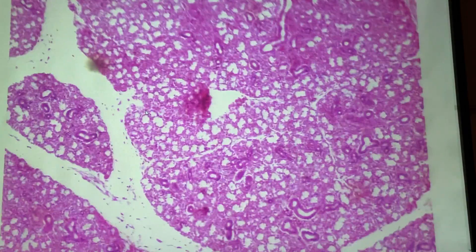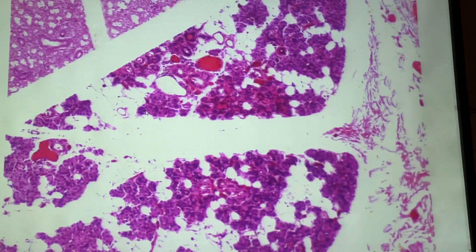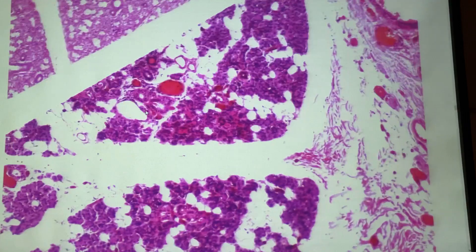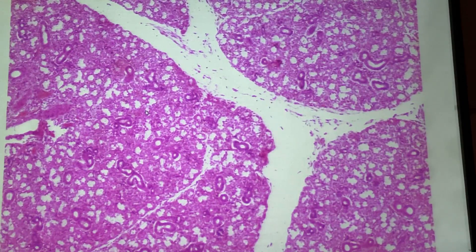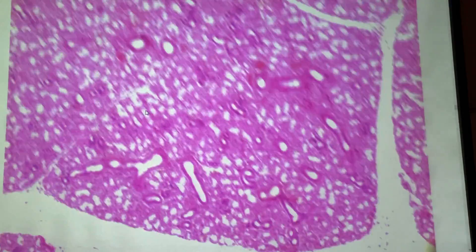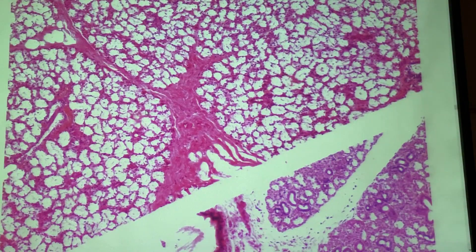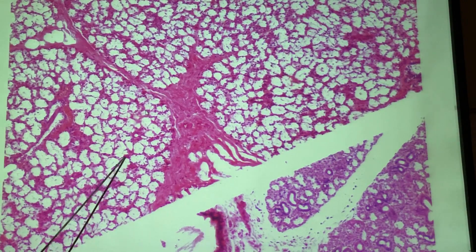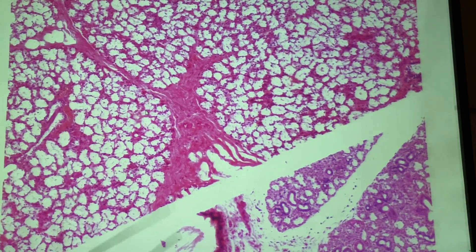Just try to note that this slide is not going to look like any of the others, except for possibly the pancreas — but I'll show you how to tell them apart. This one stands out like crazy. These two could be mistaken for pancreas if you're not on the ball, but I'll make sure you are. I'll point out the important part about the pancreas that you'll need to know. So salivary glands: lots of blood vessels, lots of wide open spaces — and that's about it.